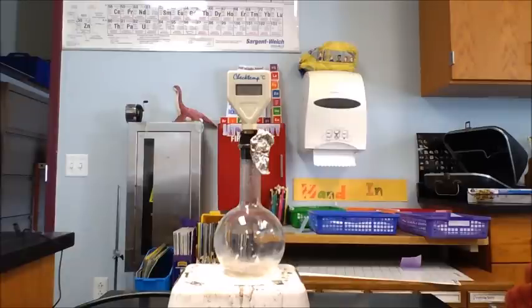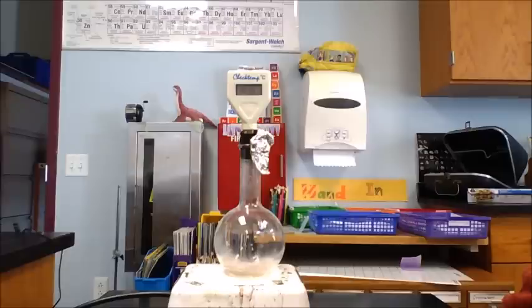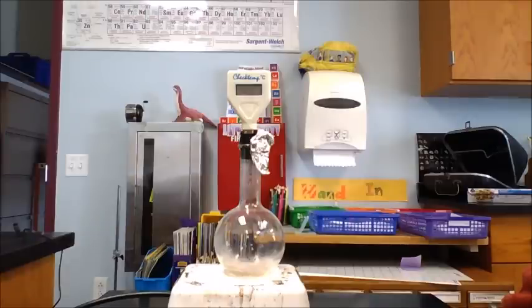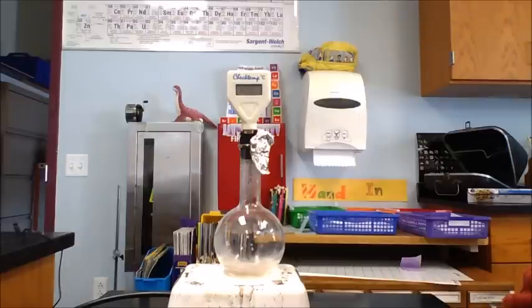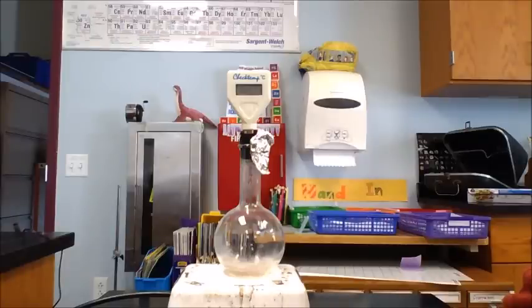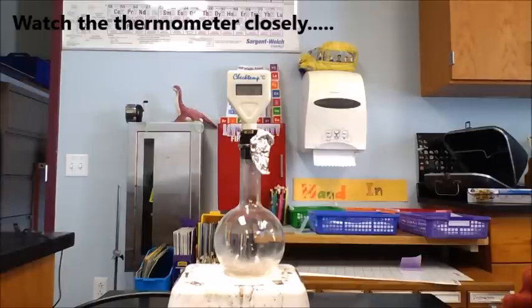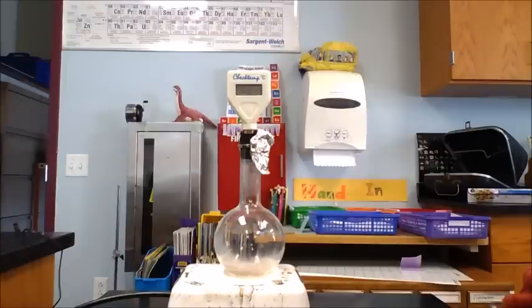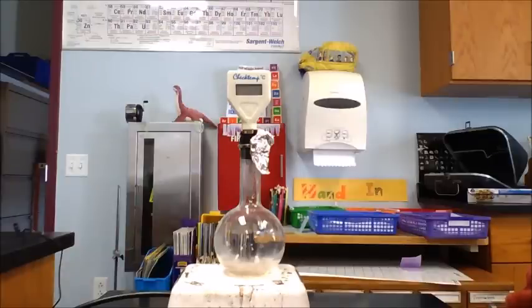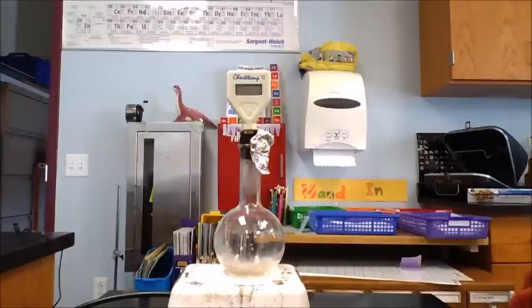Keep recording your temperatures in your data table. The temperature is going up pretty fast now. It hit 150, which is where the thermometer stops. So I'll turn this off and you guys can take a look at your data and plot it on your graph.